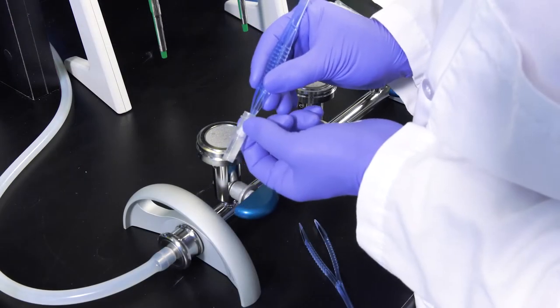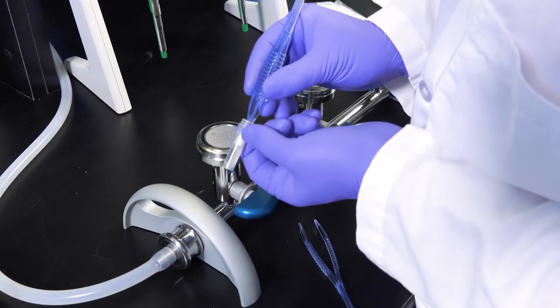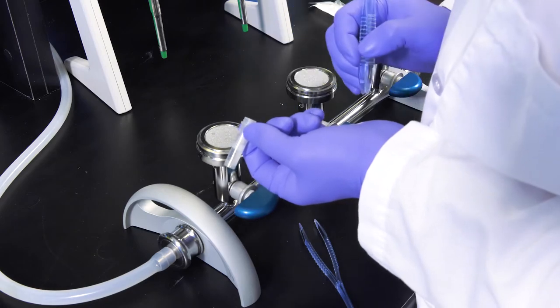Using the tweezers, place the membrane in the tube containing the one milliliter of R1 solution. Incubate for 15 minutes at 95 plus or minus 5 degrees Celsius at 1300 rpm.